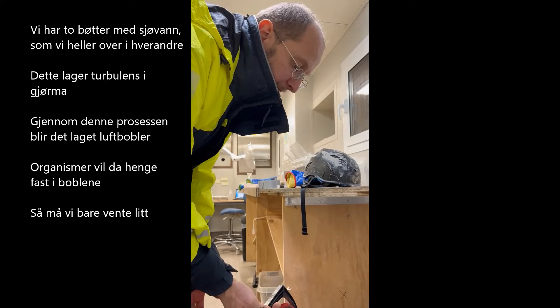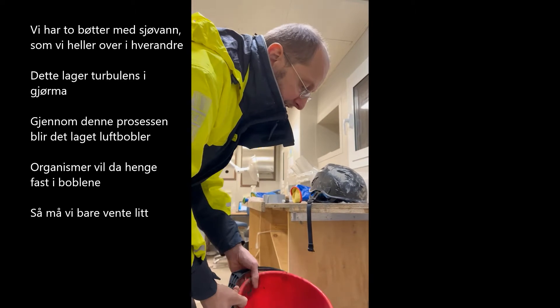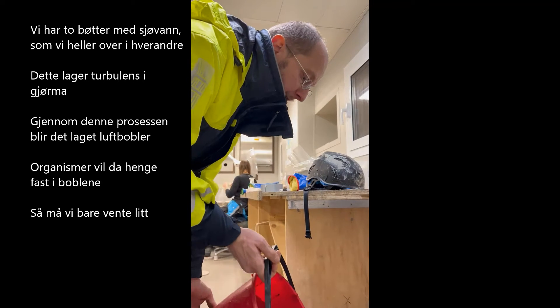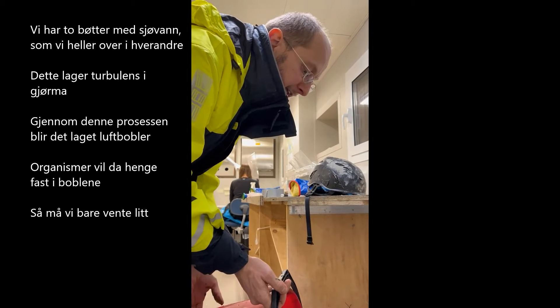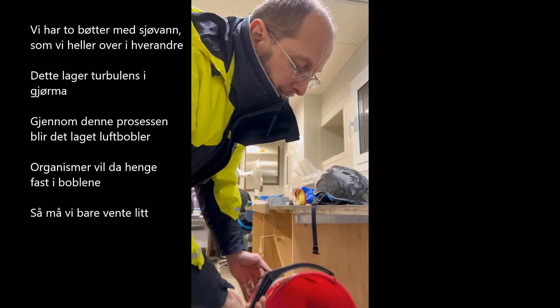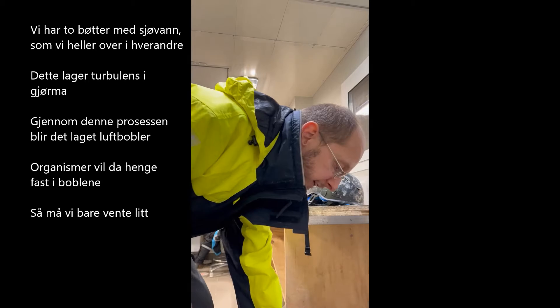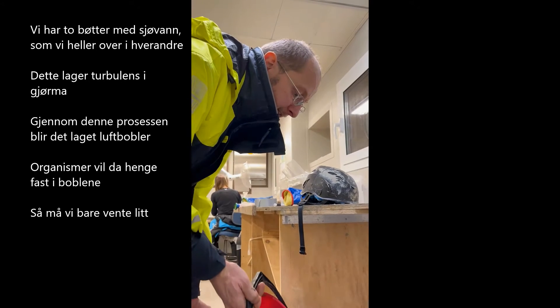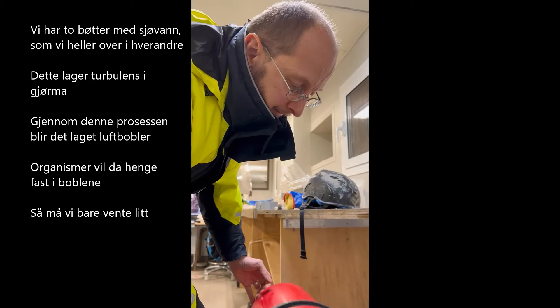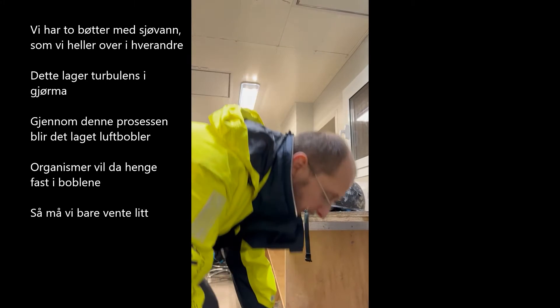We have the mud with sea water and now I generate a lot of turbulence in the mud by pouring it over from one container to the other. Through this process, a lot of small air bubbles are generated due to the turbulence, and the organisms I want to find will stick to those air bubbles.